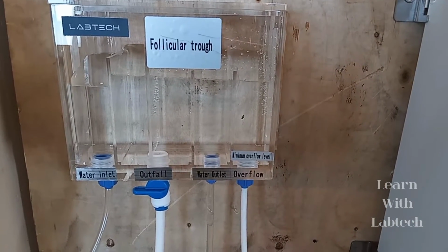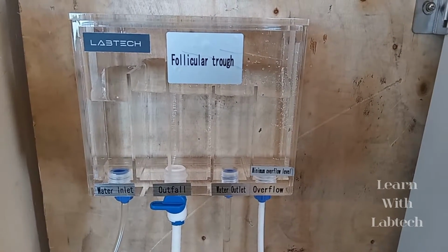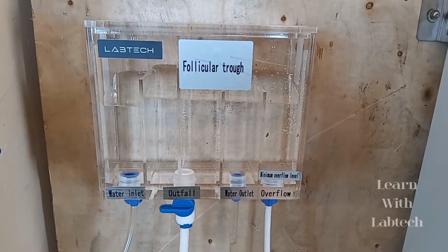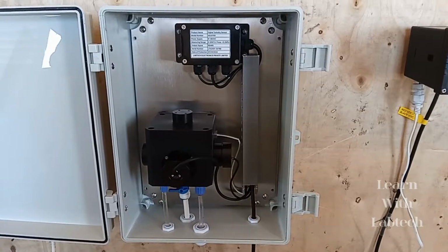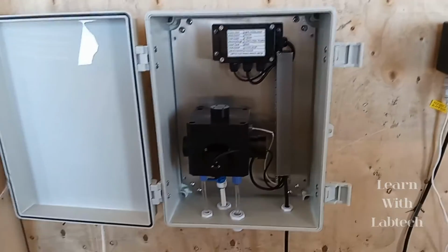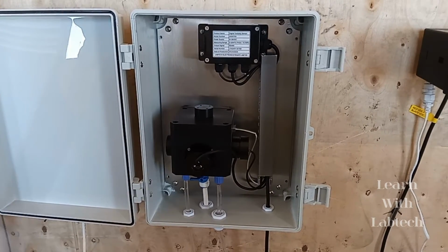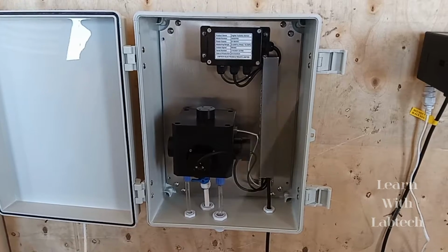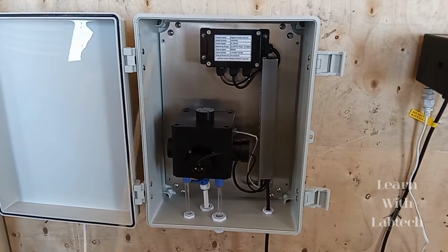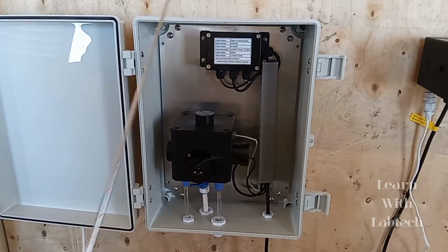We are just starting a sample flow. So let us measure the turbidity of the unknown solution. We are just pouring the unknown solution into the filter part. This is the follicular trough. This is the sample unit, as I have told. The sample flows through the sample unit, where the sample turbidity is measured. For now, we have used the unknown solution as the sample. It gets into this sample unit, and here we have the sensor, and this is the control unit.